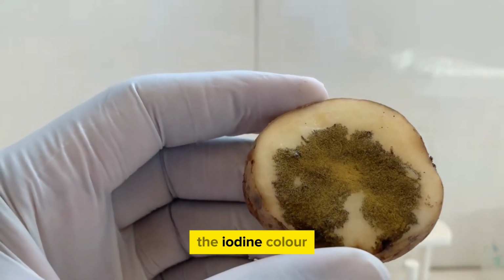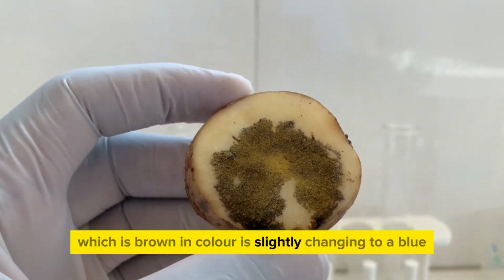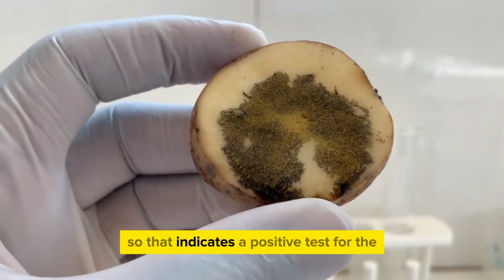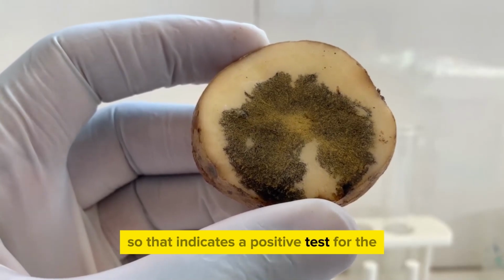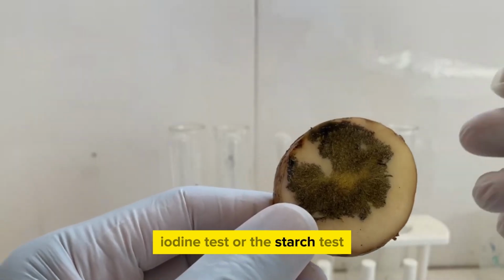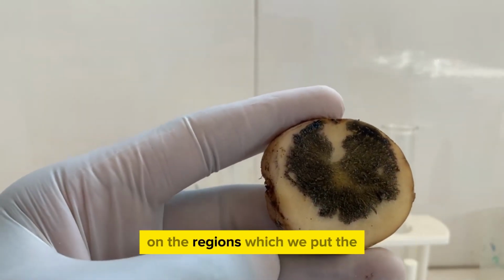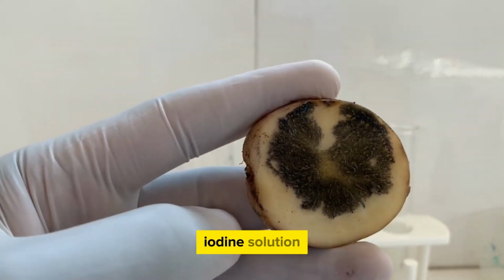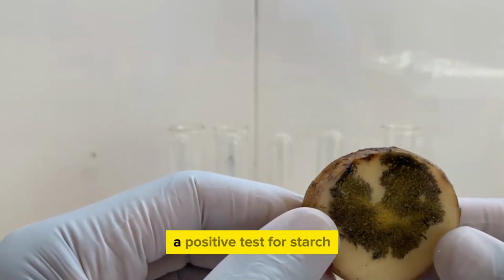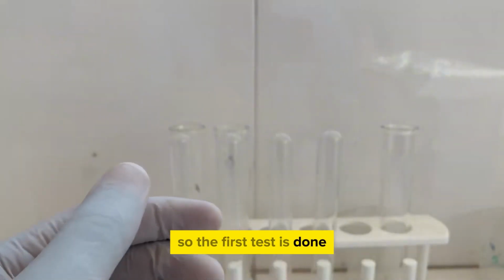The iodine solution, which is brown in color, is slightly changing to a blue-blackish color. So that indicates a positive test for the iodine test or the starch test. You can see here that our potato has turned black on the regions where we put the iodine solution, and this blue-black coloration is indicative of a positive test for starch. So the first test is done.